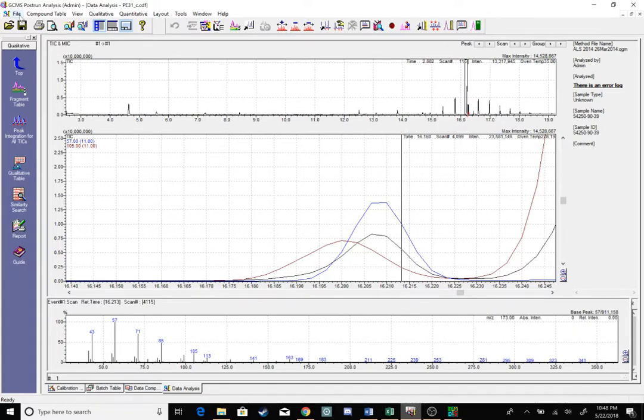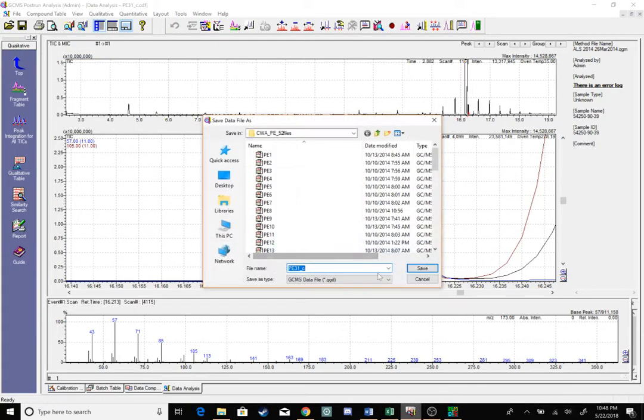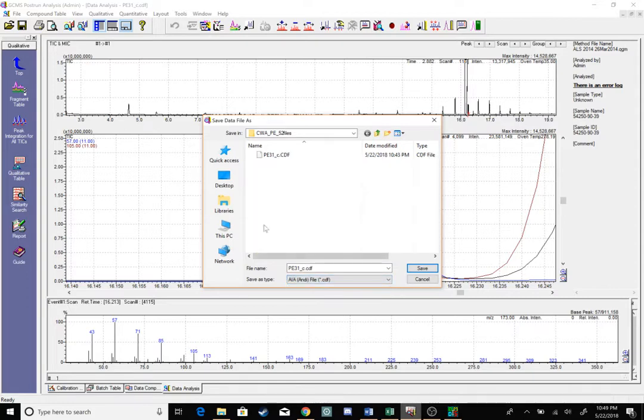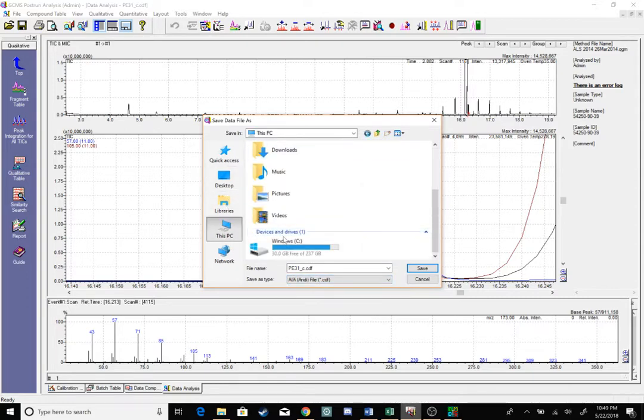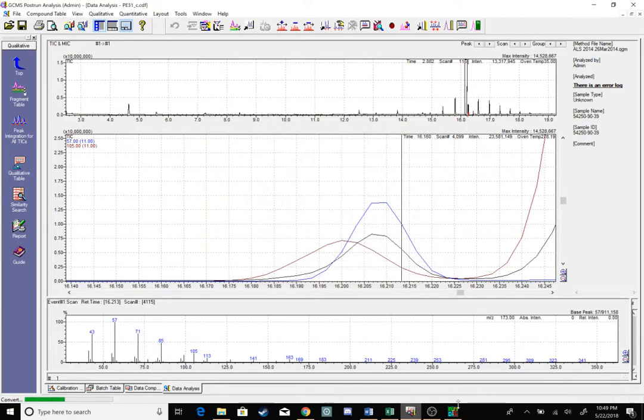So I want to save this file to be able to open it up in AMDIS. I'm going to go to Save Data File As, change the extension type to a CDF, chromatography data file, and then I'm going to throw that into my C drive under GCMS Solutions. This is personal preference, but I think it's easier to find this way. So CDF, let's go ahead and save.